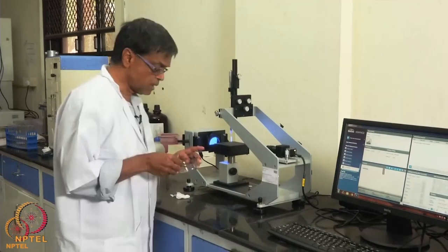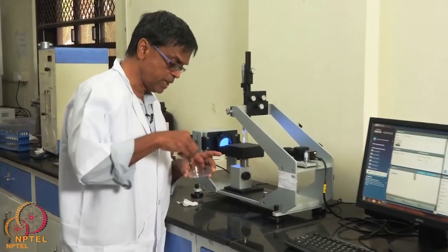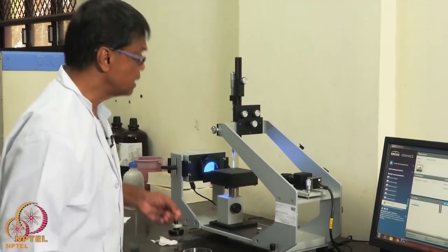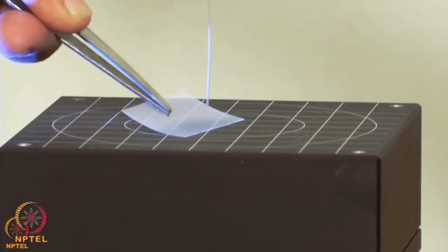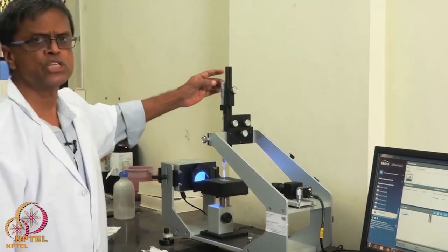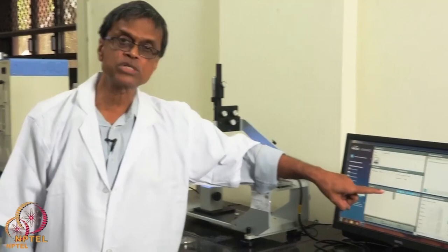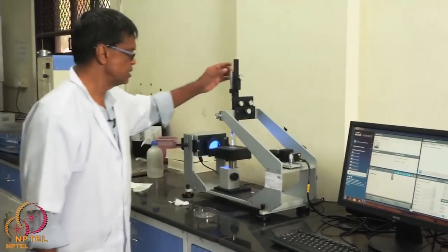Let us test it out. I am taking a sample — this is a polyester sample. Polyesters are widely used in medicine, especially in vascular grafts and even in some diaphragms. It is biodegradable because it has got an ester bond. We place the sample, then I turn the knob so that the water comes down and settles as a single drop. From the computer screen you can follow the drop coming down and settling on the surface.